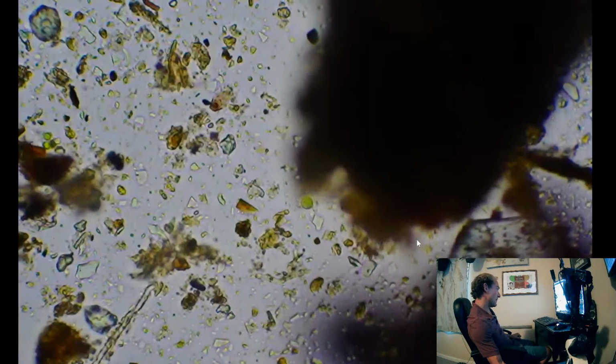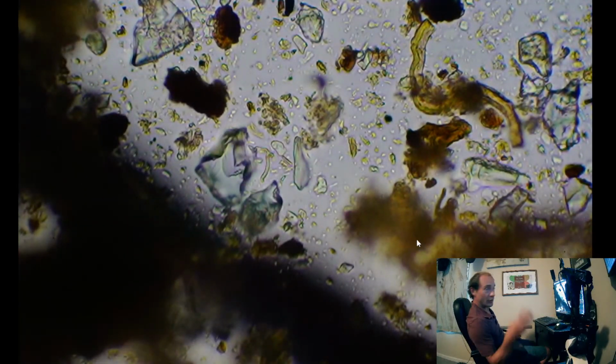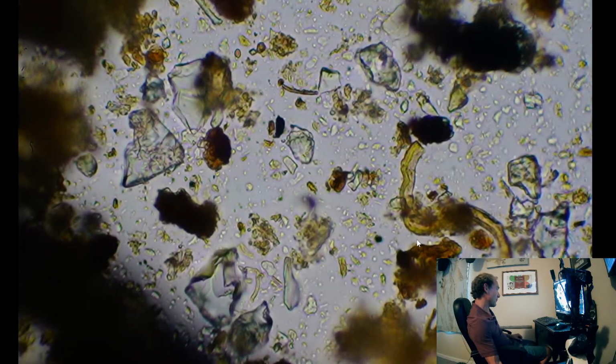A bacteria that eats juglone. Bacteria does eat a lot of stuff, and there are so many different strains. We can only see three different basic shapes under the microscope, which is the only identifying property we have.